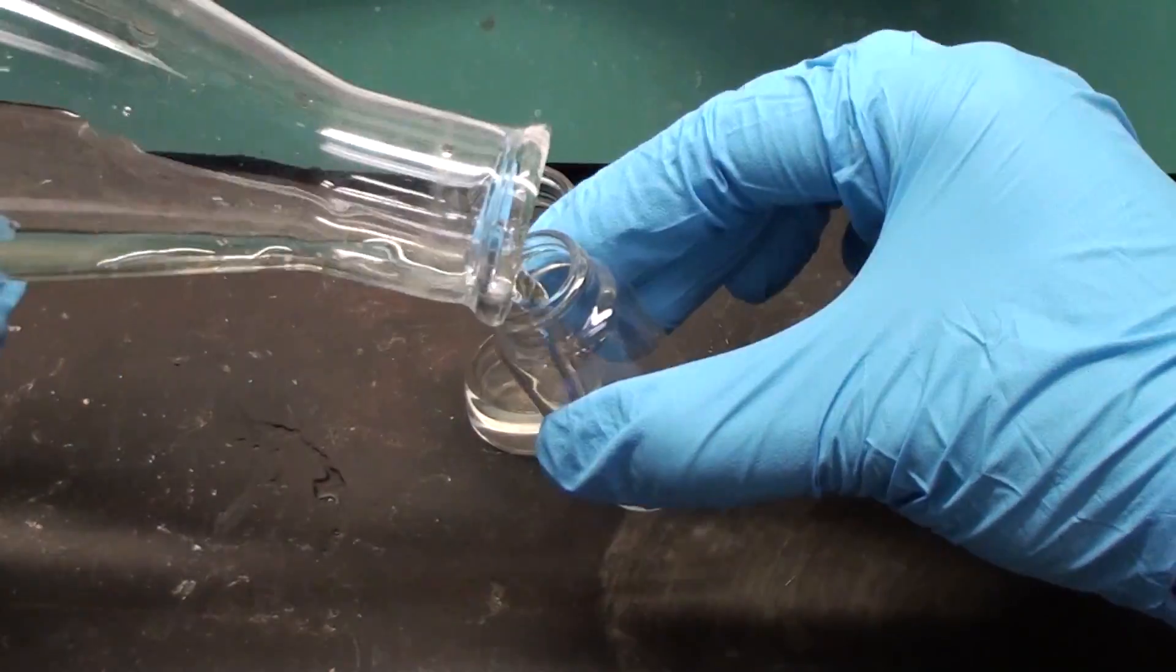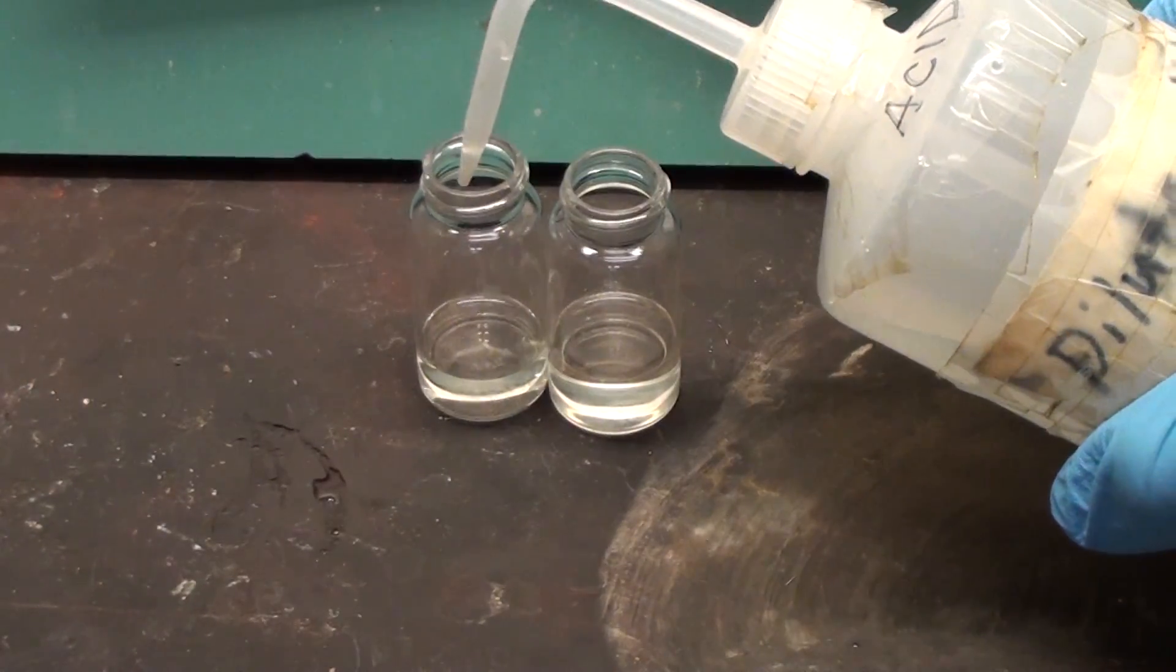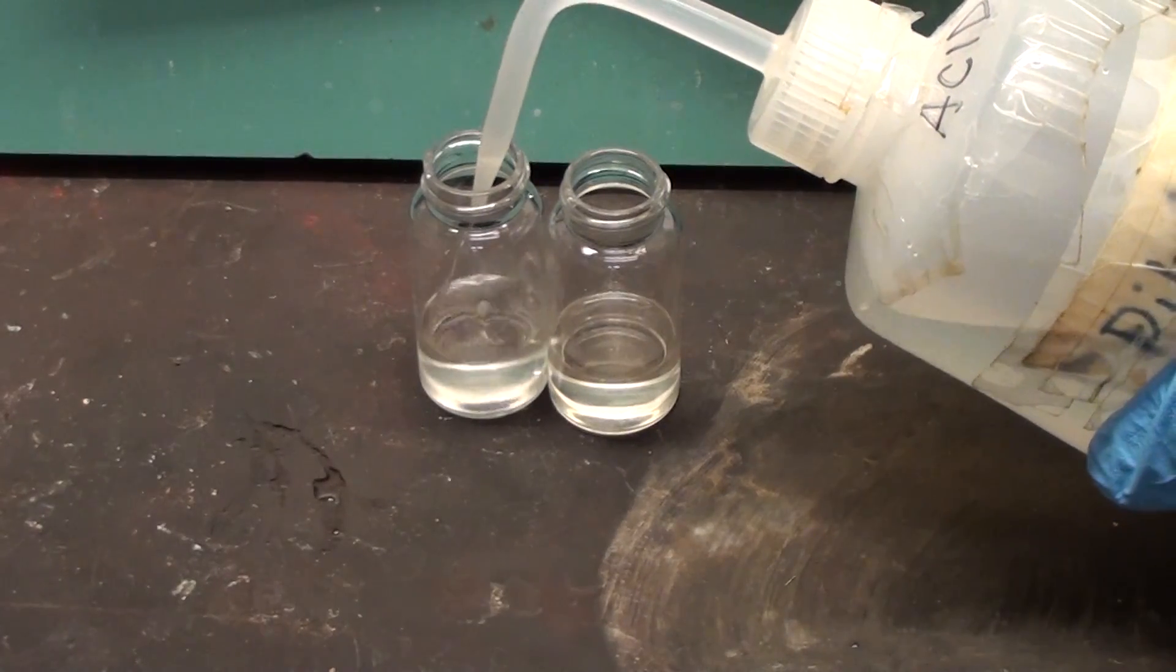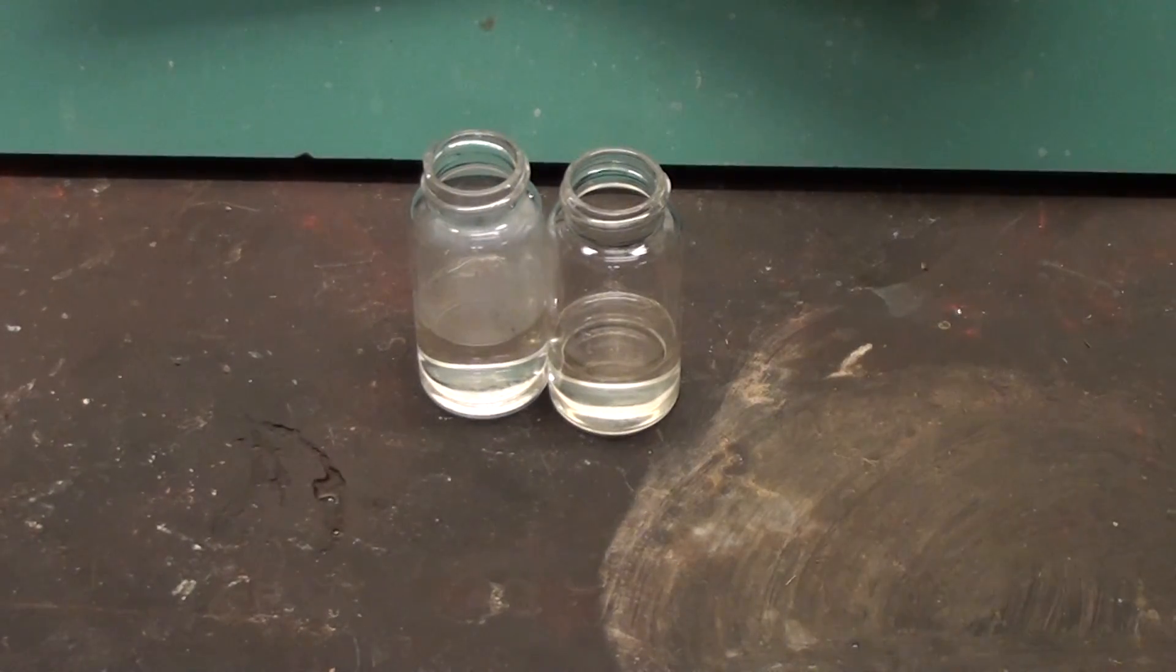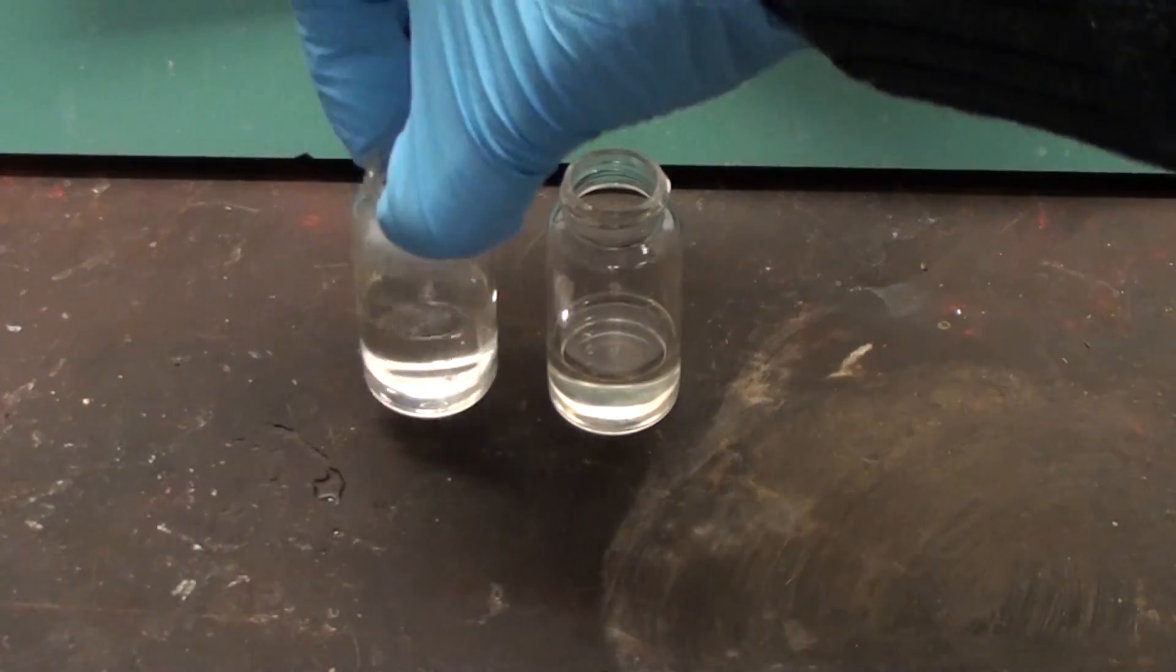I'm doing this to prove it's not sodium bicarbonate. Sodium bicarbonate would bubble when mixed with acid as it releases carbon dioxide. It's not doing that here.